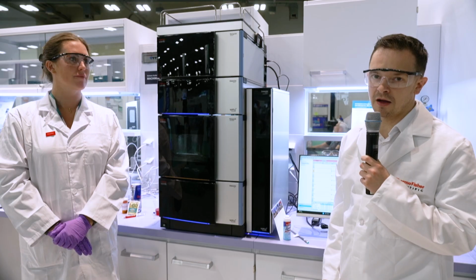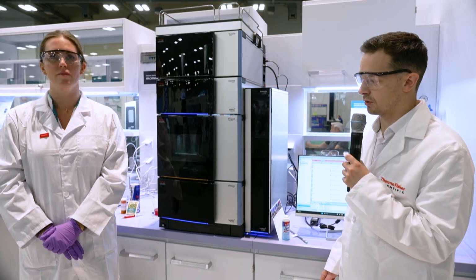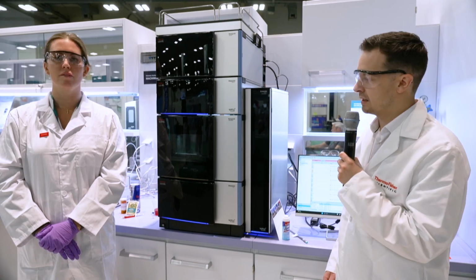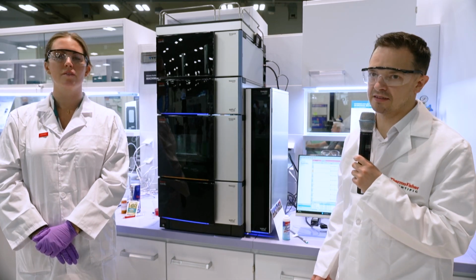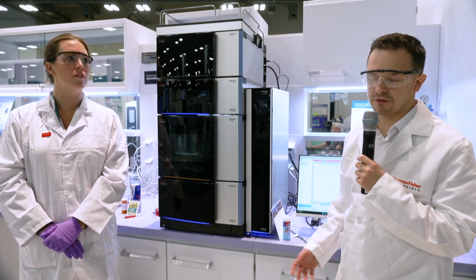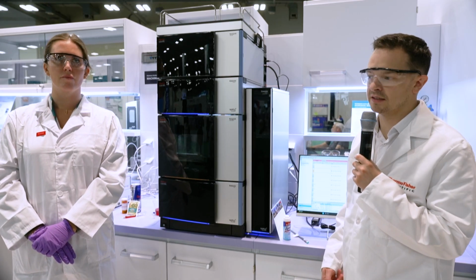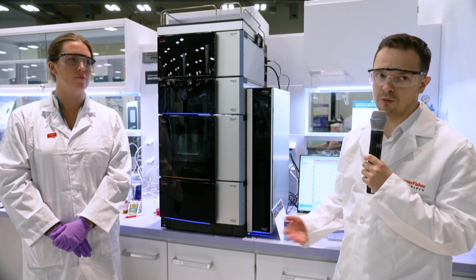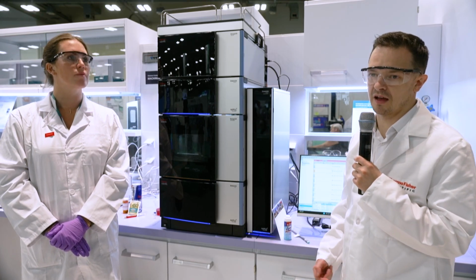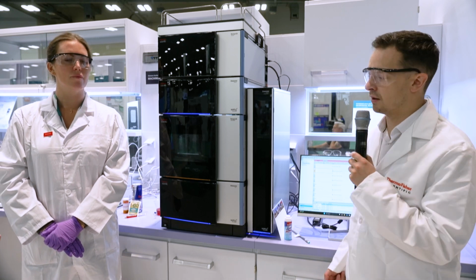But today we're going to be focusing on pharmaceutical analysis, so looking at Polysorbate 80. This is a compound that you'll find in many therapeutics, such as vaccines, such as the flu vaccine, COVID vaccine, along with cancer treatments and other therapies as well. You'll also find it in cosmetics.